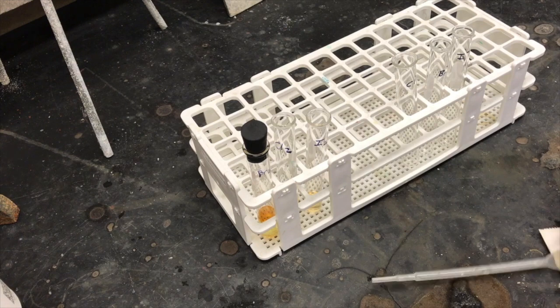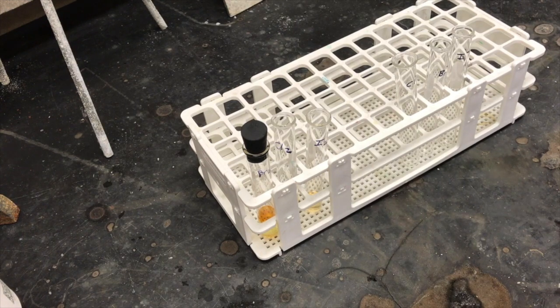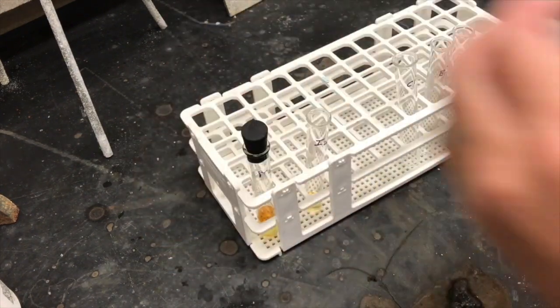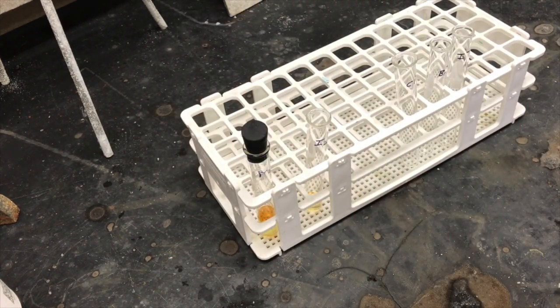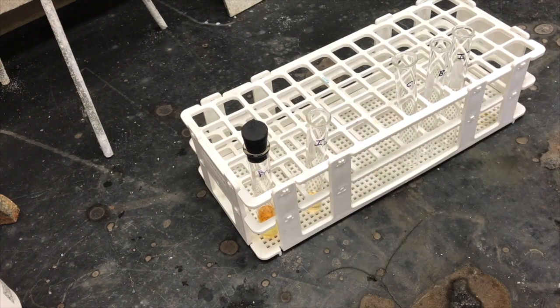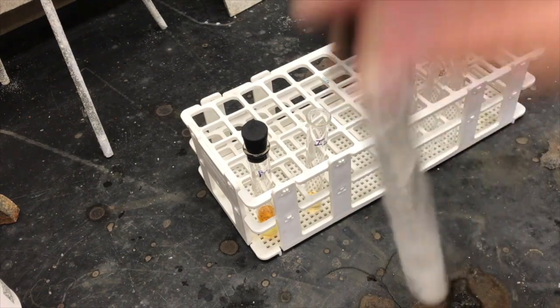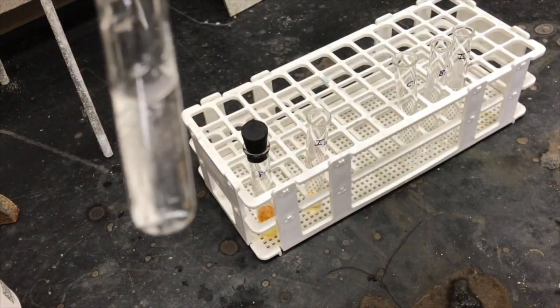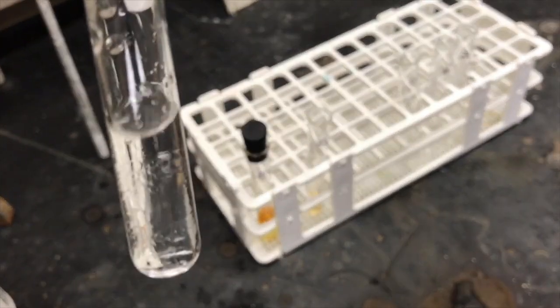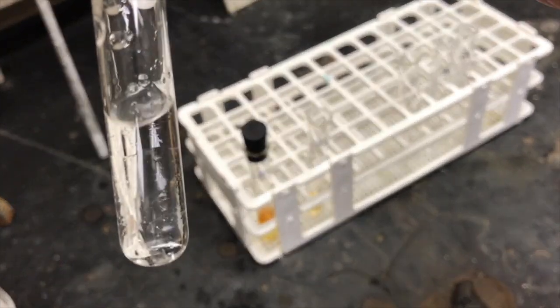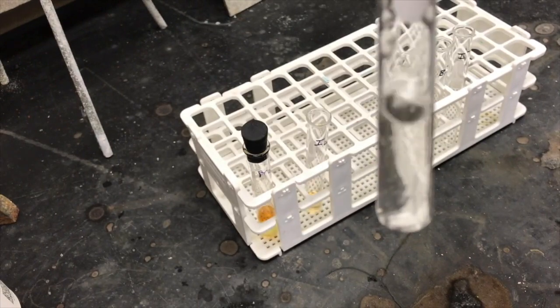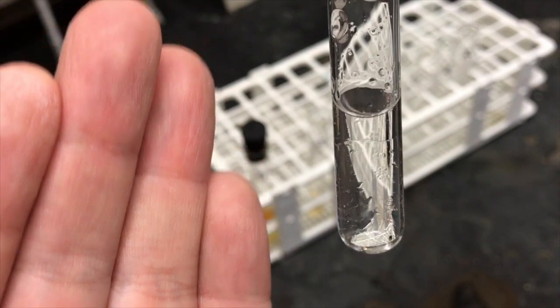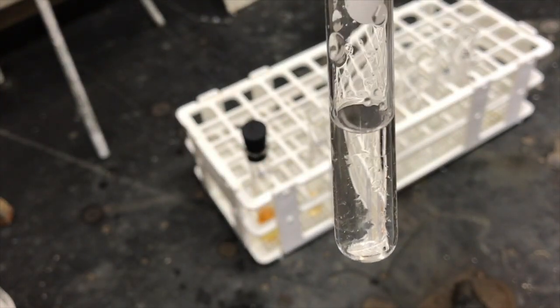We do that with the chlorine. It may be faint to see but the hexane layer of chlorine has a faint yellow whereas the aqueous layer is just clear, straight up clear.